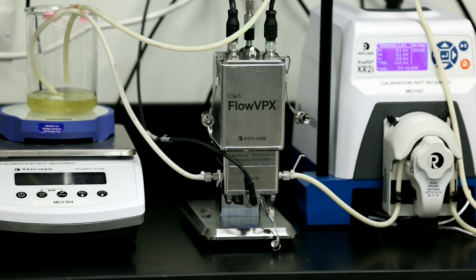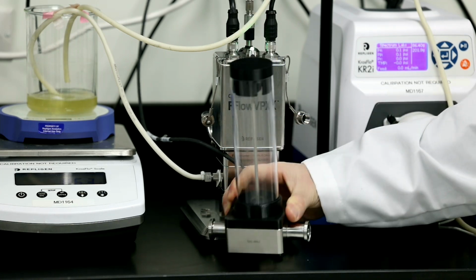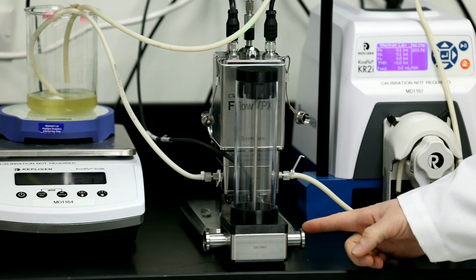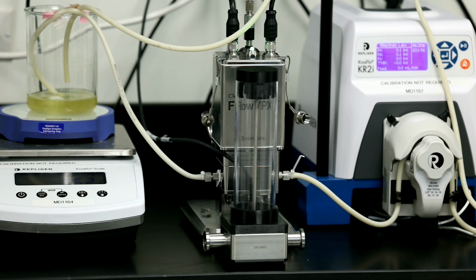So what I actually have here today, right now, is the 10mm flow cell. As you can see here, it is much larger, but this would be our pilot scale. So this can go up to 20 liters per minute for flow rate. All of them are rated for 80 PSI in pressure. But again, if you need to go to a higher flow rate, then you just up the flow cell size, which our largest would be the 2 inch.